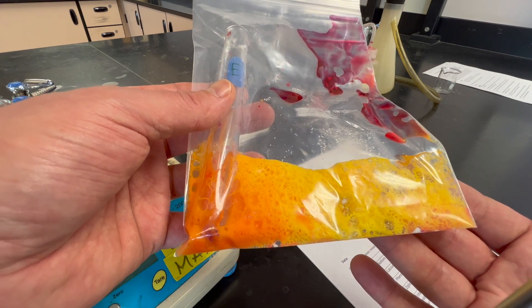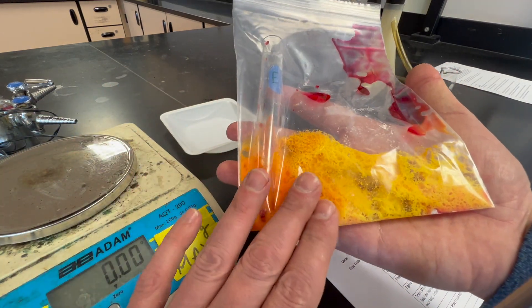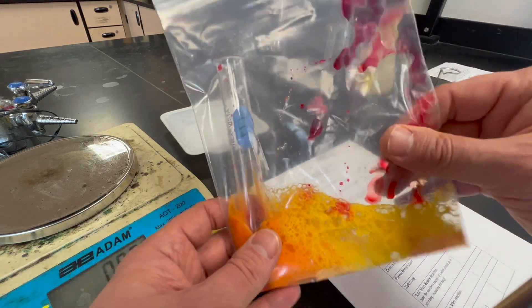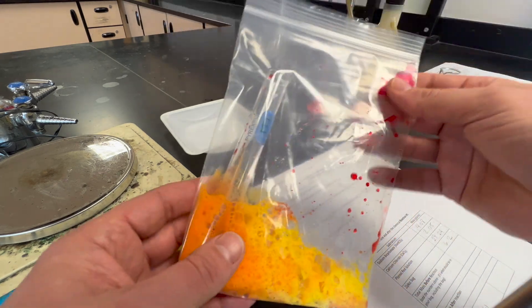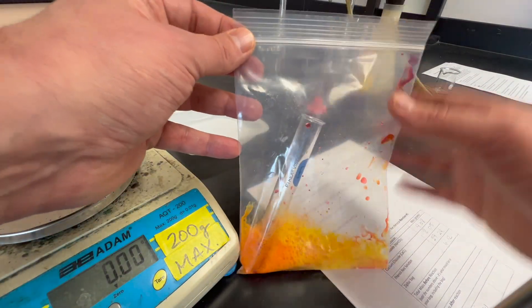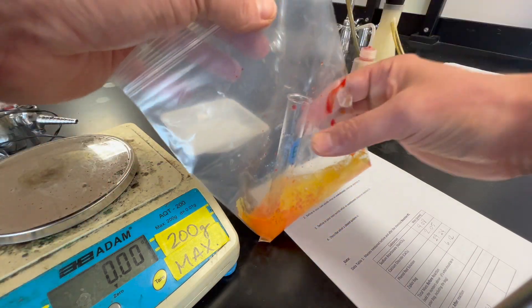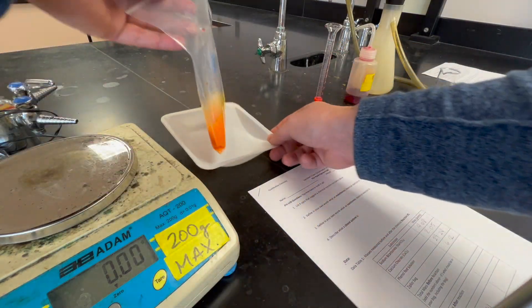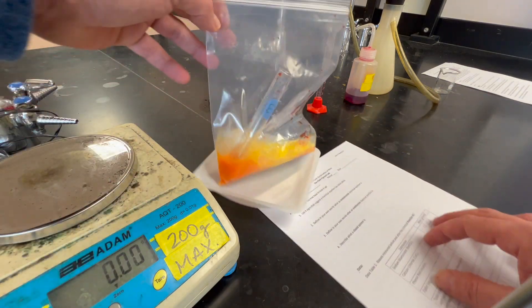I'm seeing some signs of chemical reactions here. The bag does get cold. At this point we would make our observations about the four signs of chemical reactions, and we would do that over the next three minutes.